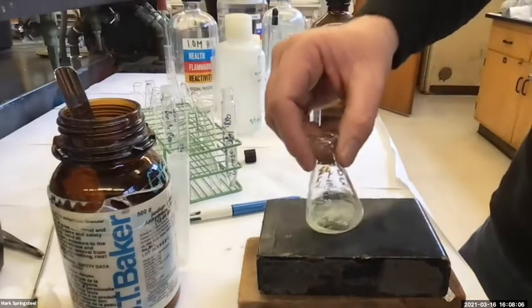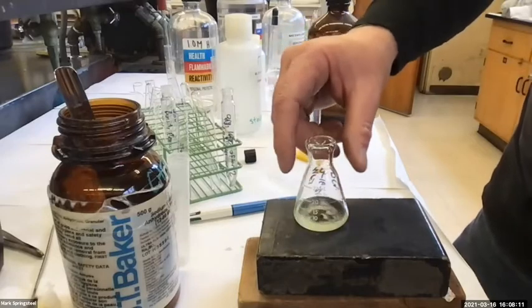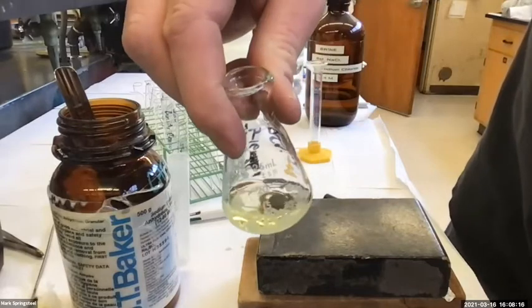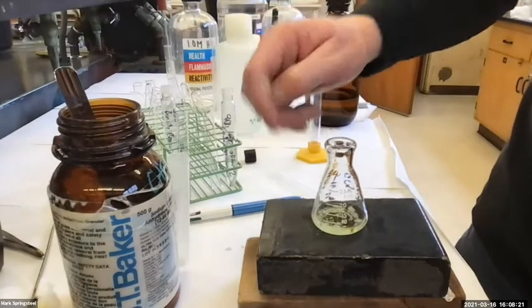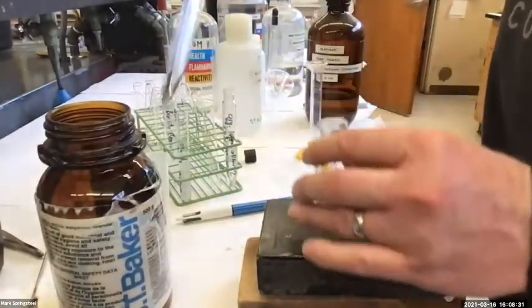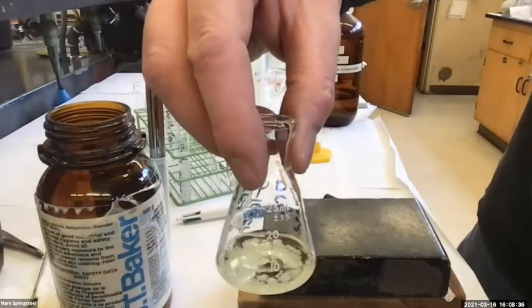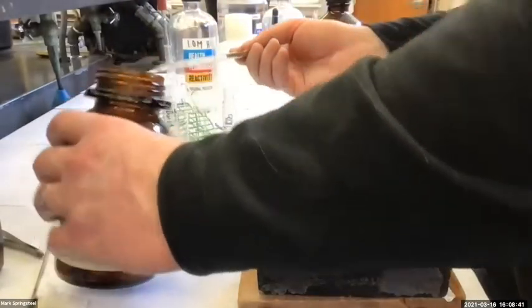When I do, I can see the sodium sulfate clumps up. I might even be at the point where I've added enough. Can you guys see big clumps of it? Yes. That means it's hydrated. When I add sodium sulfate and it no longer makes clumps, it stays as little grains, that means I've added enough, because there's not enough water to clump it up. So I'm going to do a little bit more. I think I'm already pretty close. I could see a few. I'm going to go a tad more, and then I'll call it.